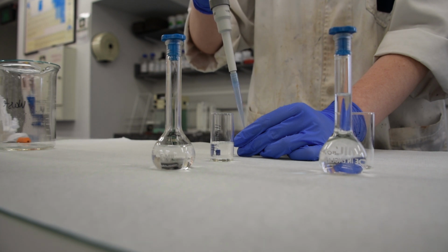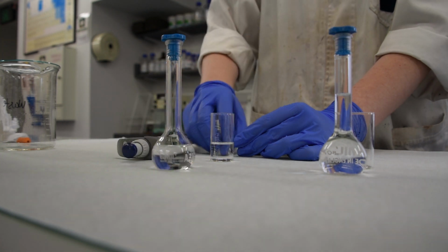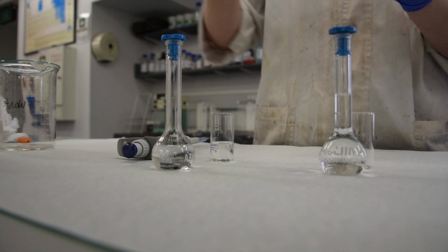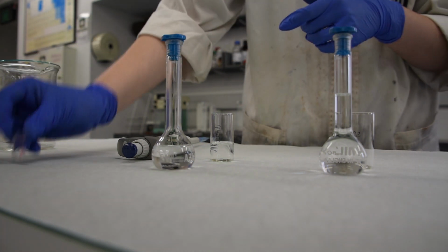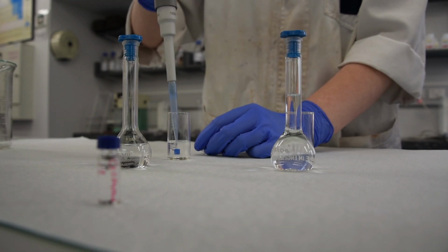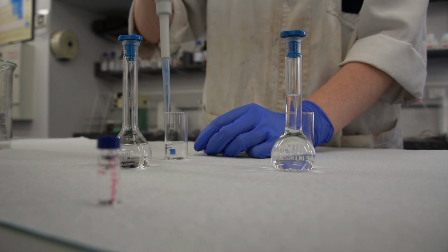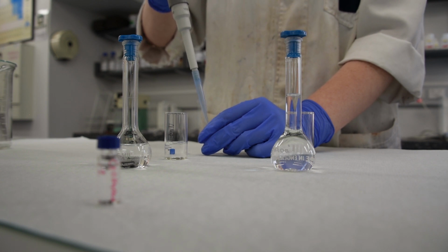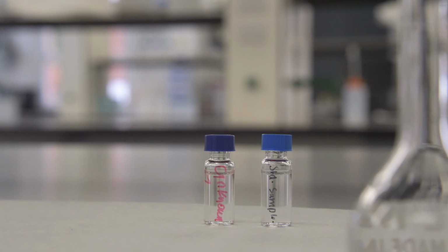The vial of the unknown already had 0.75 mL of the unknown in it. To this, 0.75 mL of the undecane internal standard mixture was added. To a second GC vial, 0.75 mL of the 3 hydrocarbon standard was mixed with 0.75 mL of the undecane internal standard. By ensuring the 2 vials had the same amount of internal standard, the height of the peak of the internal standard could be used to correct for any fluctuations in the instrument response between runs. The 2 samples and the sample of the acetone were run on the GC instrument.